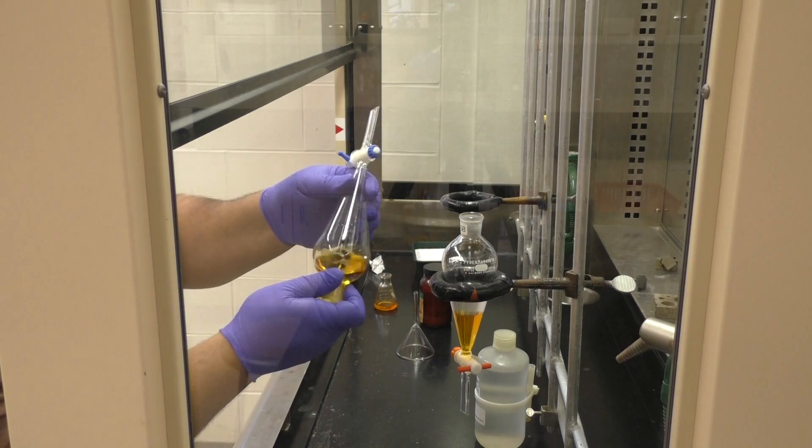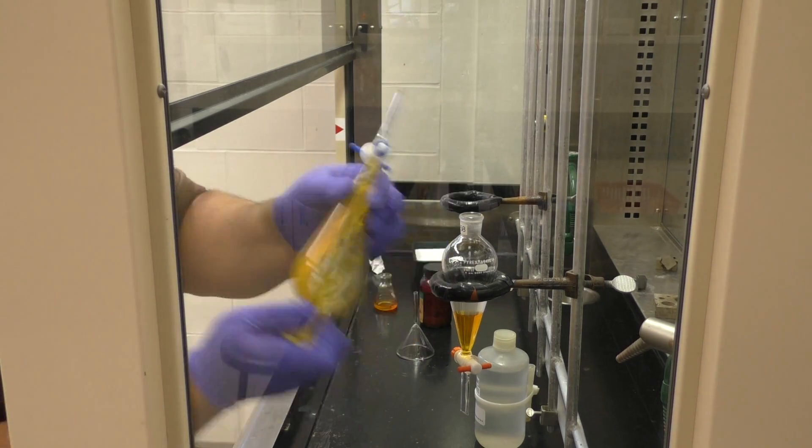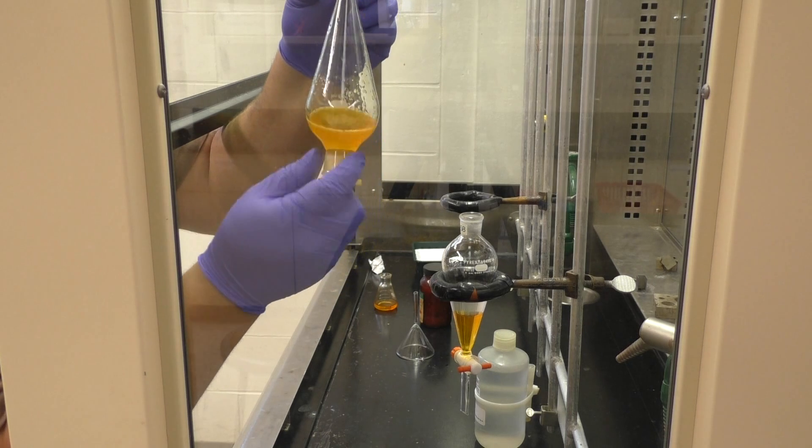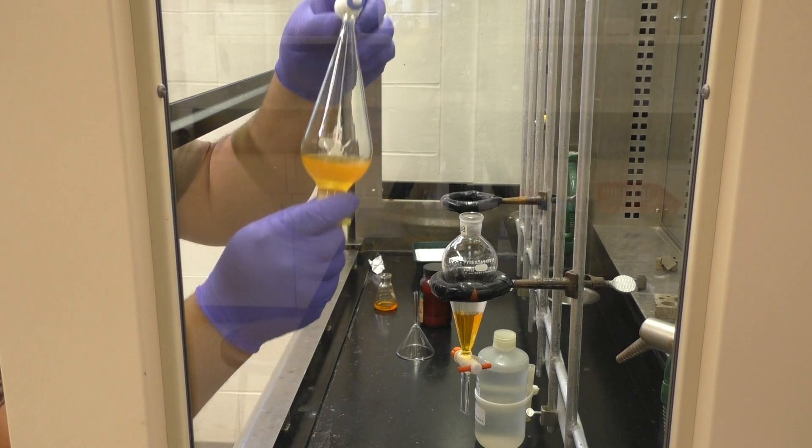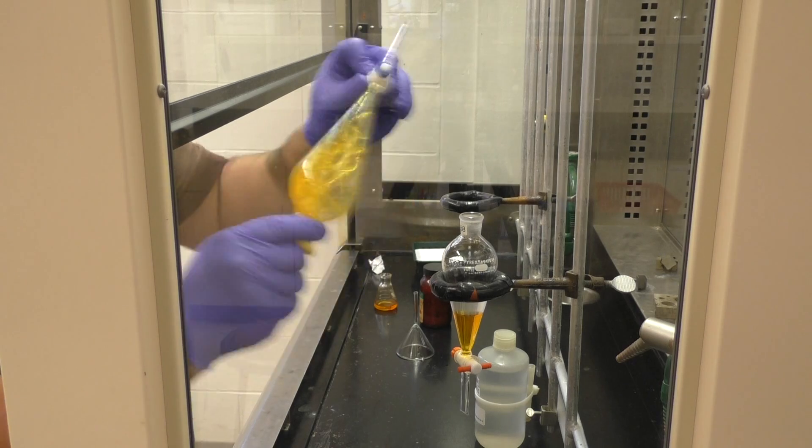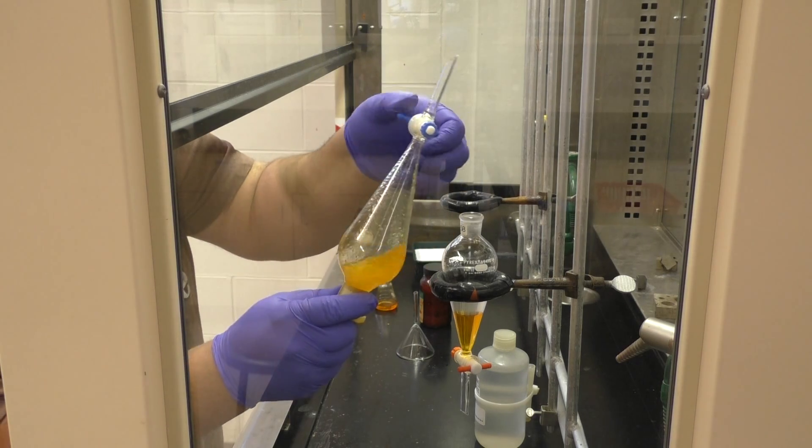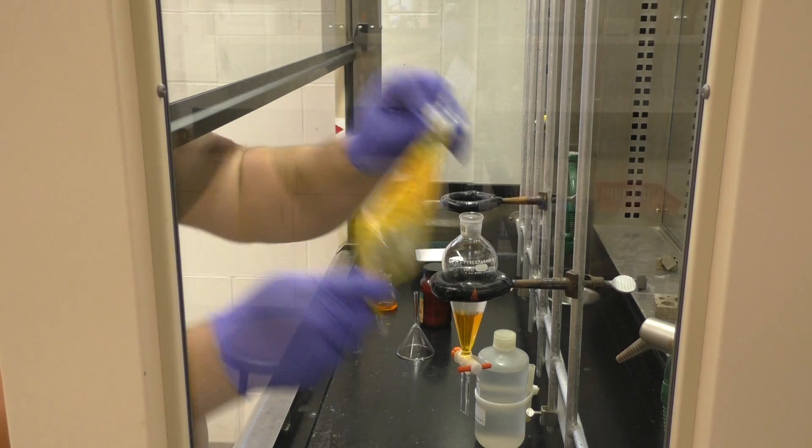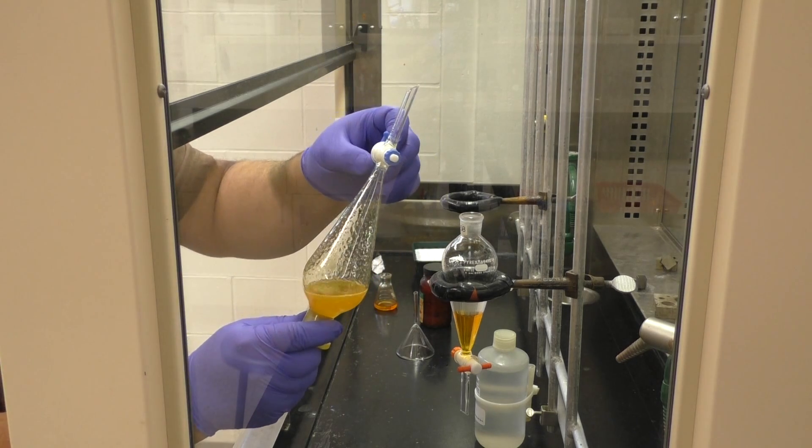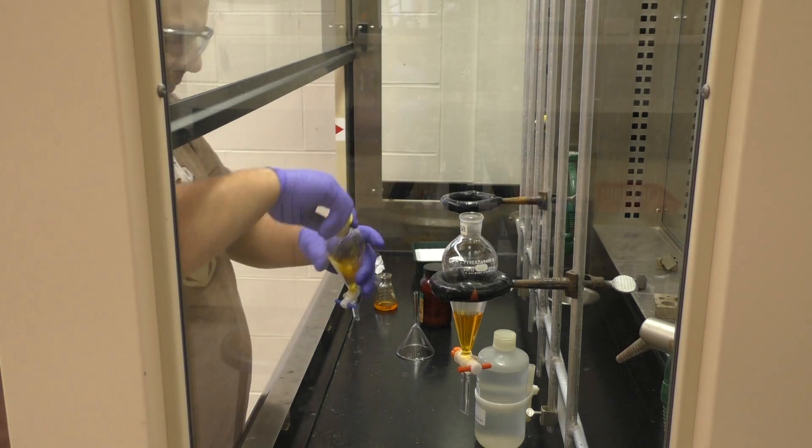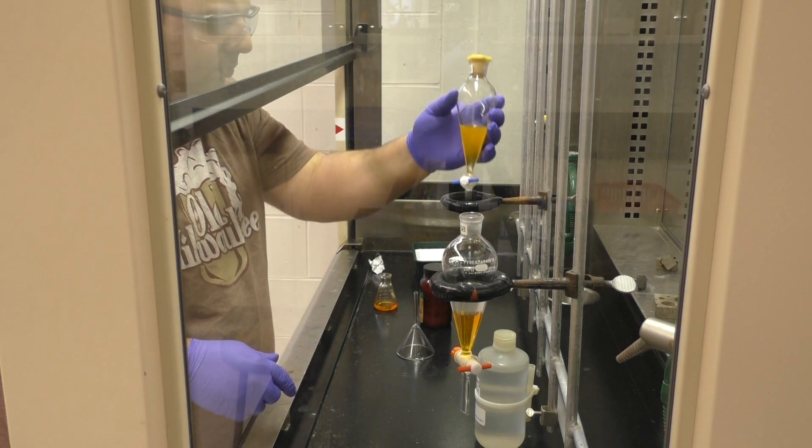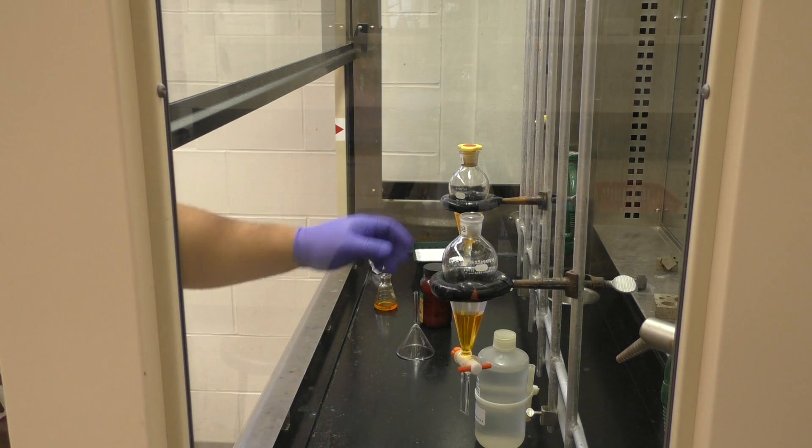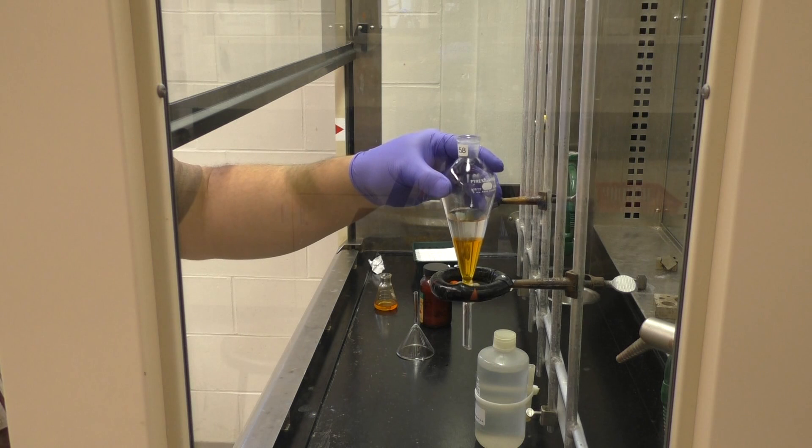but do not do that. I can't tell you how many marks you're going to lose for lab performance. And frankly, this lab doesn't have enough lab performance marks to match that. You'll be losing more than for just one experiment. I did it in the video for the purposes of showing it, plus knowing what's in here, and knowing that I'm going to have to clean it up, and that there's relatively no risk as far as harming anybody else. Again, you do that in the lab, I can't tell you how dead you are.